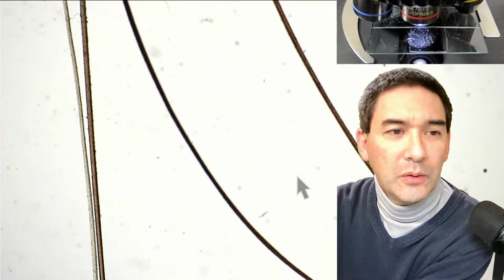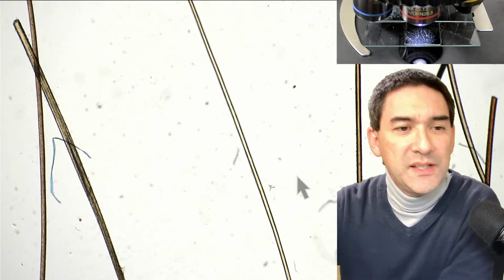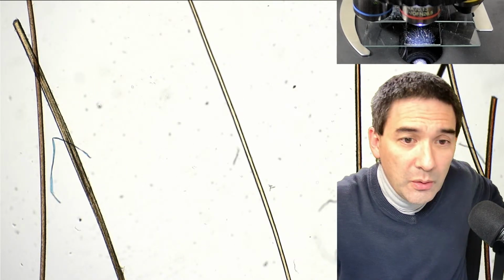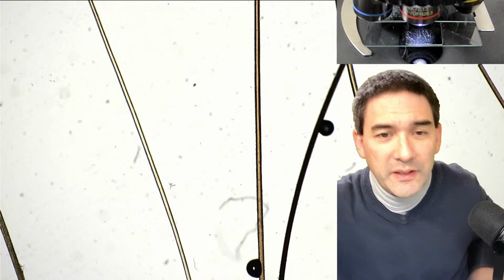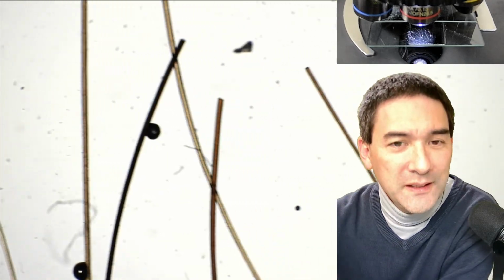Okay, here we go. I will also tell you a little bit of how I actually made it in an arrangement like this. It wasn't so easy, but we can already see at the lowest magnification, let's turn off the arrow, that the hair, obviously, not only has different colors, but also different thickness.